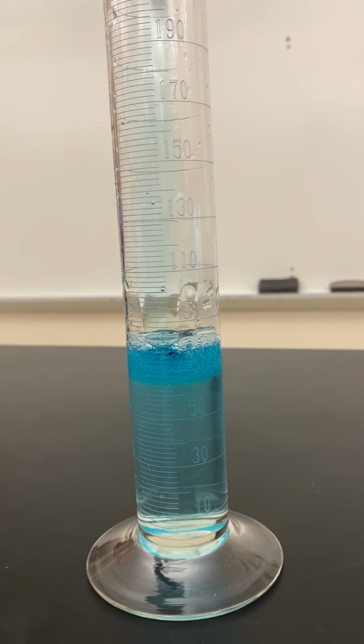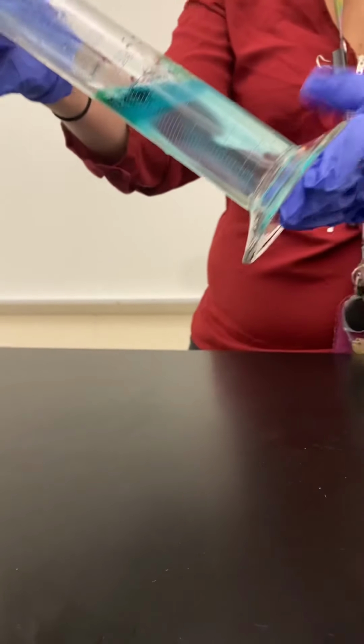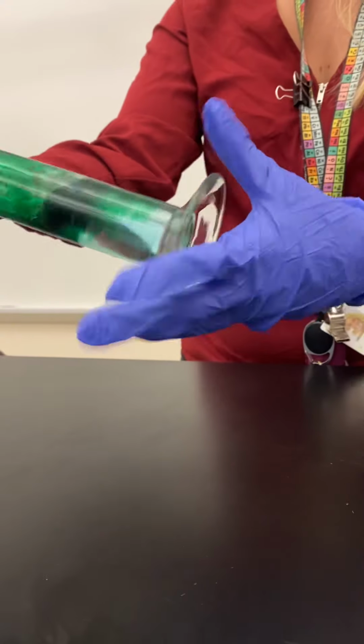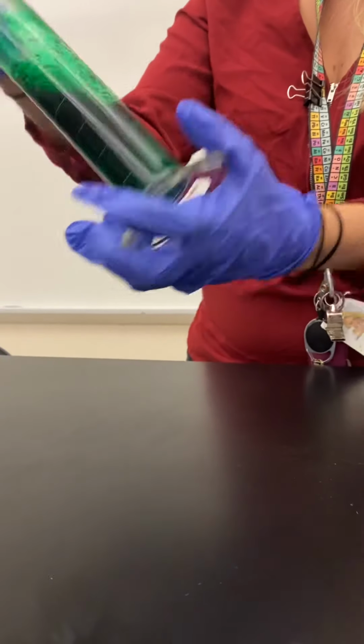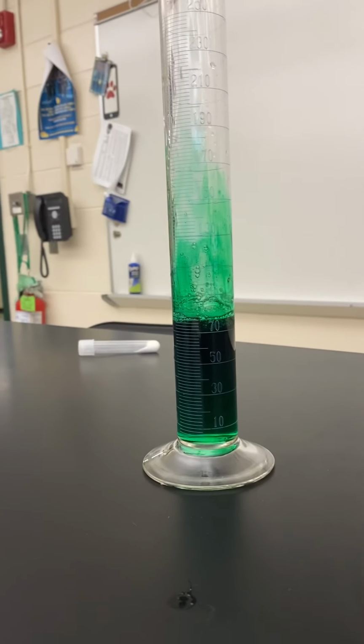You can put that one here because I use it here. That's good. I'm just gonna mix it up a little bit. And then Nick, I'm gonna have you add the catalyst in a moment. But I'm gonna put a tray to help kind of capture this.